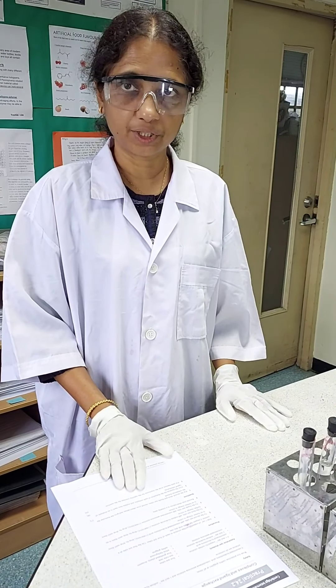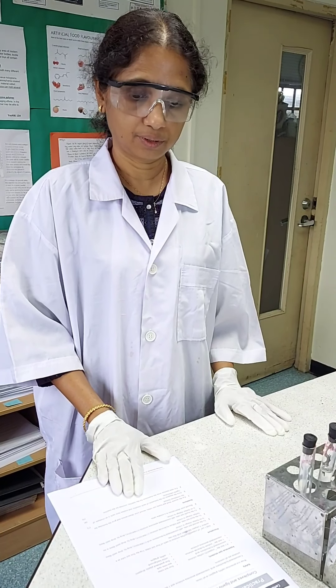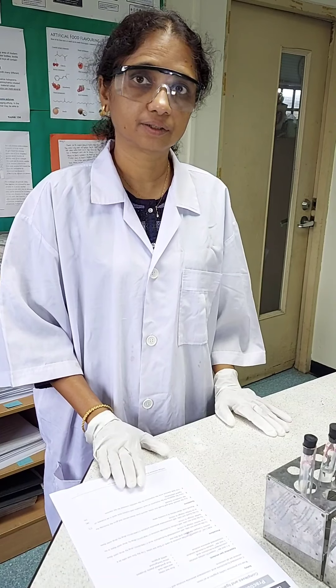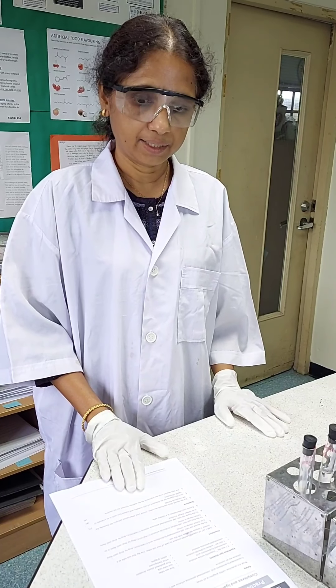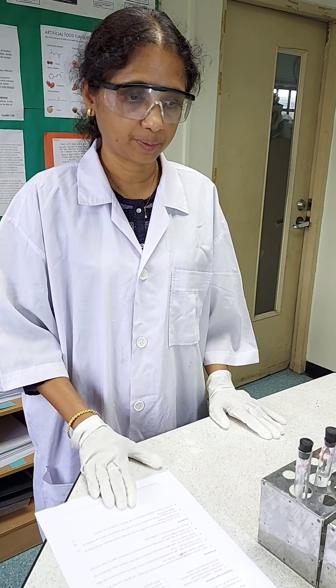Close observations are to be made, and the observations, note it in a suitable table and then answer some of the questions which I will be asking at the end of the experiment.